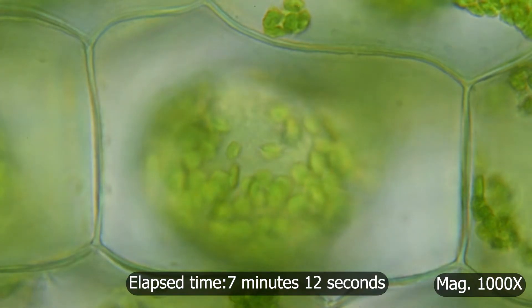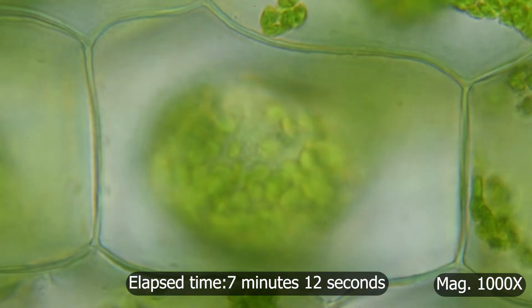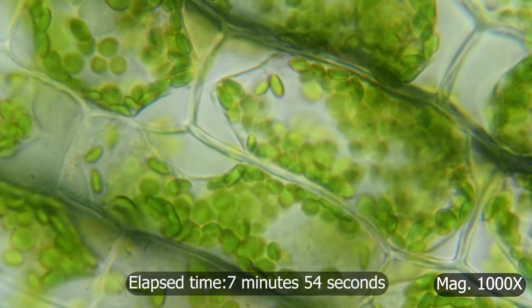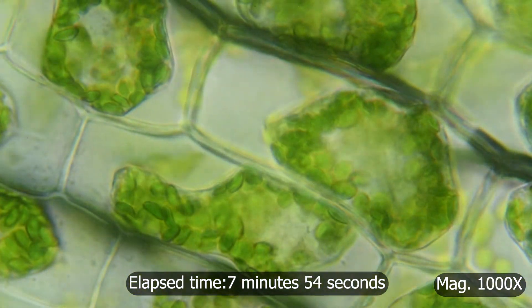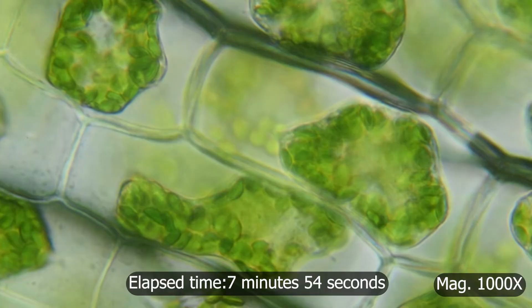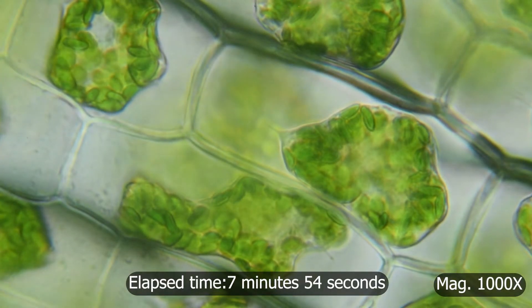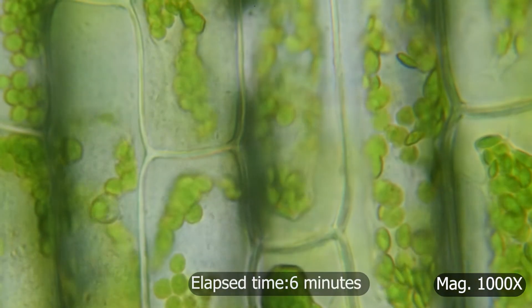The cell membrane can be seen collapsing as the cell loses water. This can be seen a lot easier when the footage is sped up. It's also the same process that causes plants to wilt as they dehydrate from water loss.